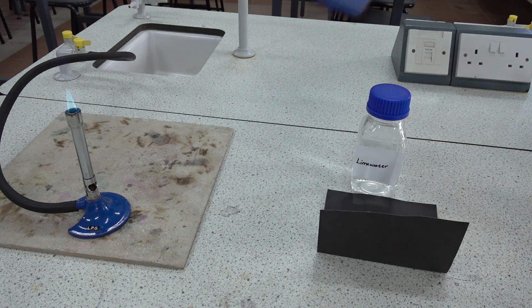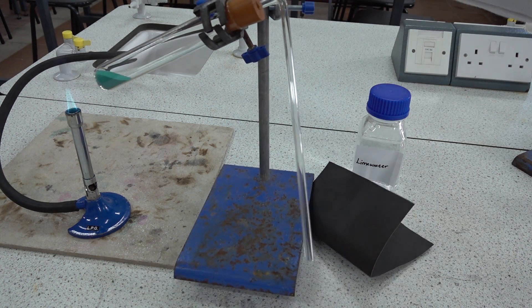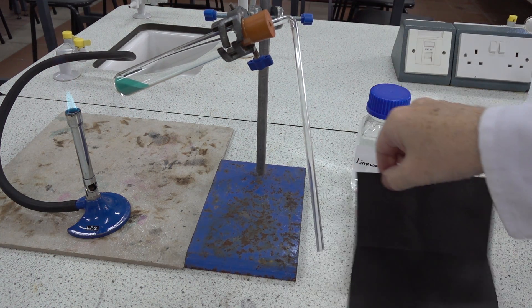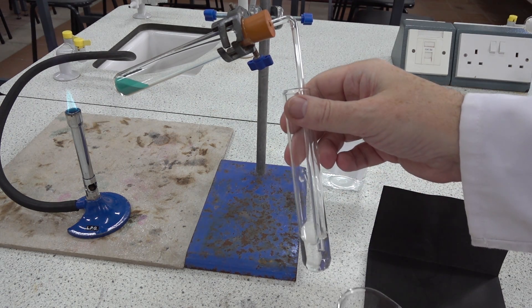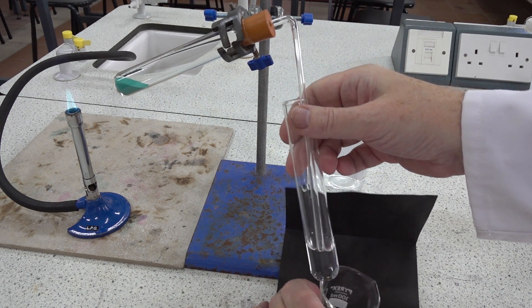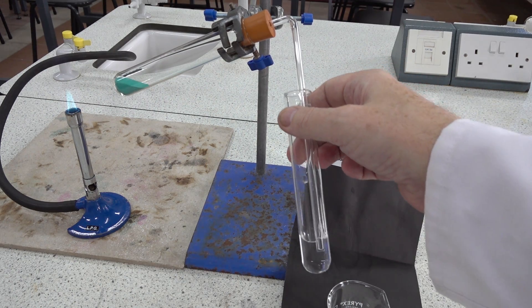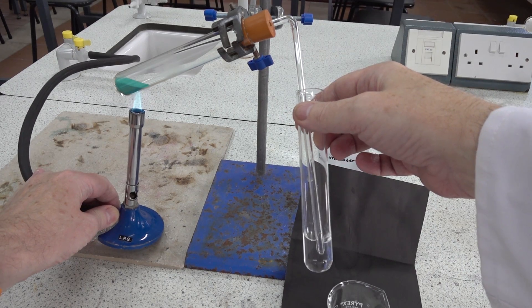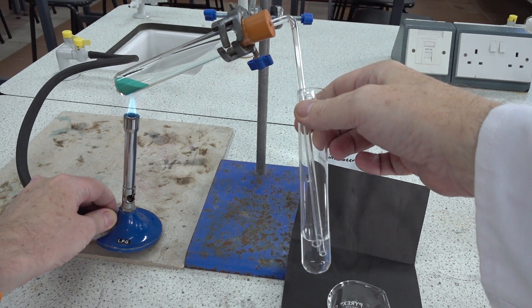We have a second experiment, and this one we'll be heating another carbonate. This one's bright green — this is copper(II) carbonate. Again we'll bubble our gas through limewater with the black paper background to detect any change on screen. Let's compare this one and start heating the copper carbonate. Again we immediately get some bubbles as we're displacing air.